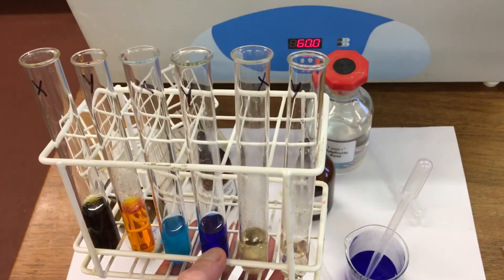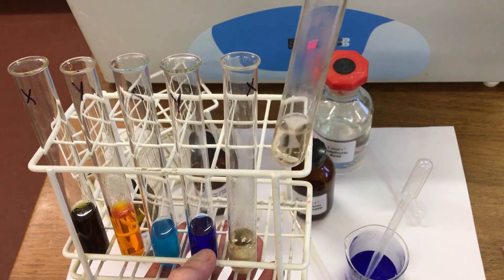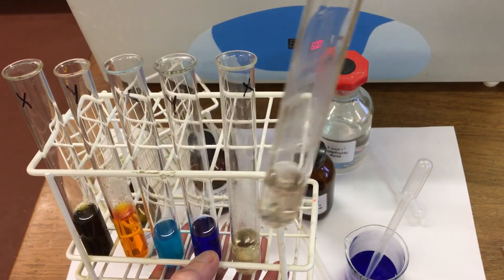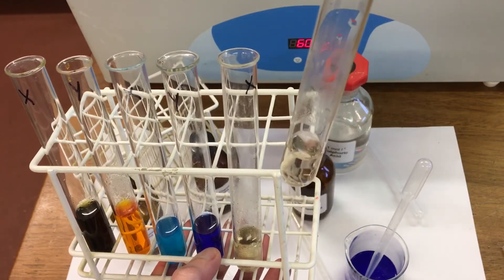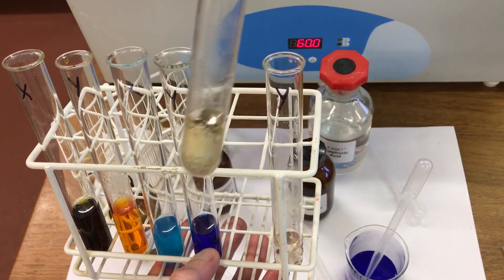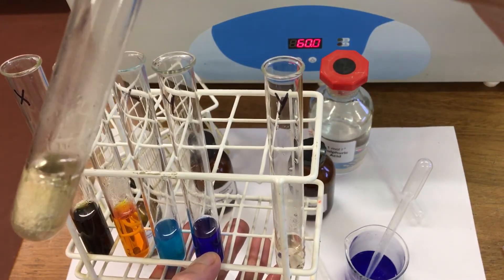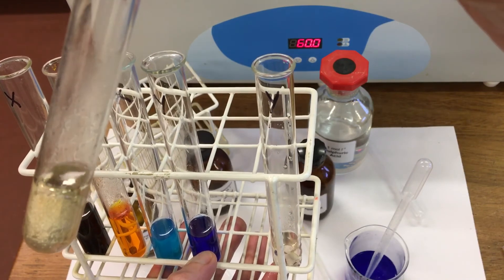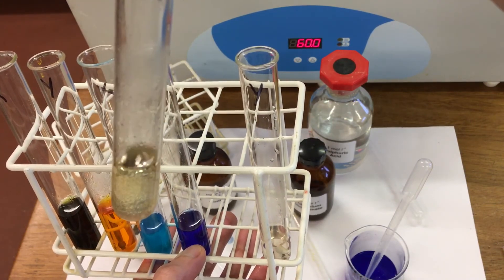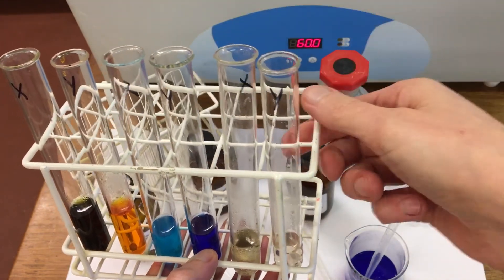For the Tollens' reagent, we can see Y — no color change, stayed the same. And in X we've got almost like a silver mirror in our test tube, so that one has oxidized.